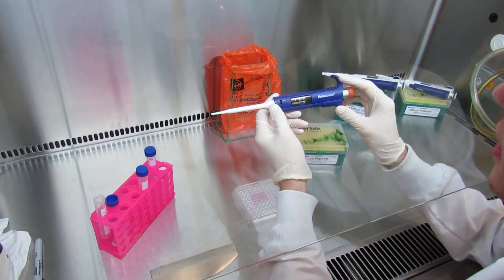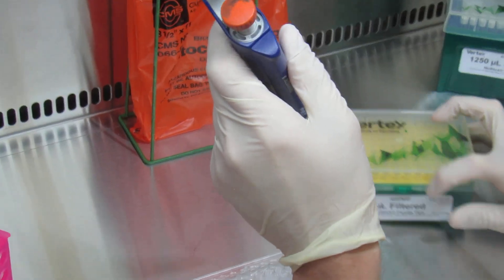I take the 20 microliter barrier micropipette and I set it to 10 microliters and grab a tip.